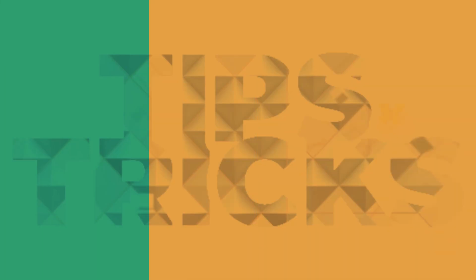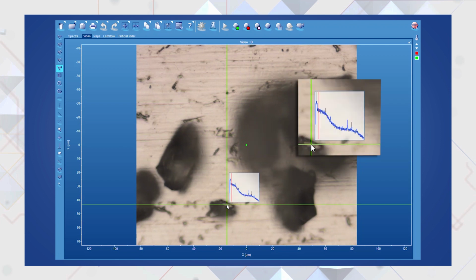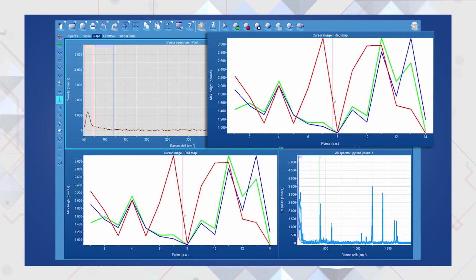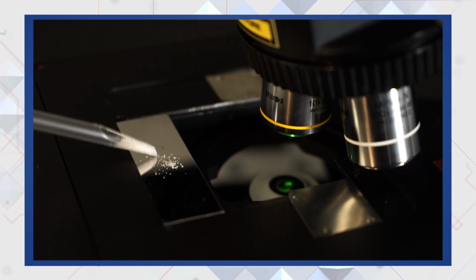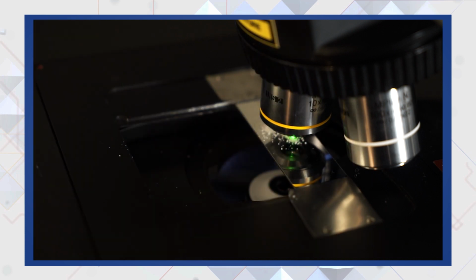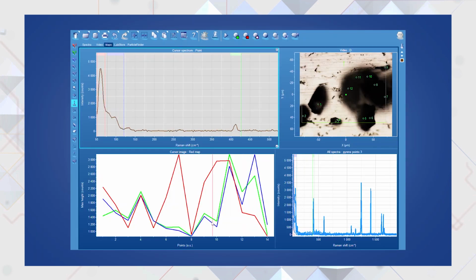Raman Spectroscopy. Today we will see a tip for measuring the Raman spectrum of a crystalline material. Looking at a crystalline powder sample, we see the relative intensities of spectral bands change as we jump from particle to particle. If you need to identify your sample by searching in a library, the match quality index may be lower than expected. This is because crystals of your sample have different orientations relative to the laser's polarization direction and the instrument's response function, and therefore produce spectra with bands of different relative intensities.